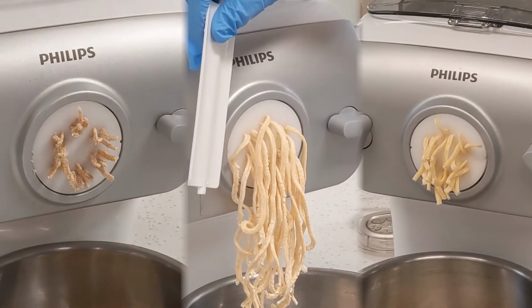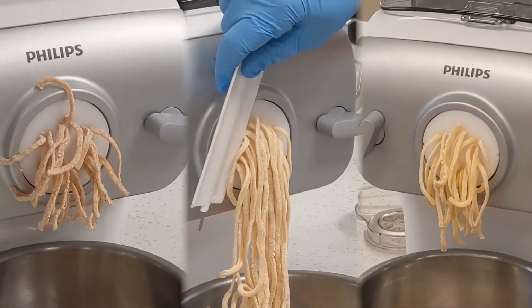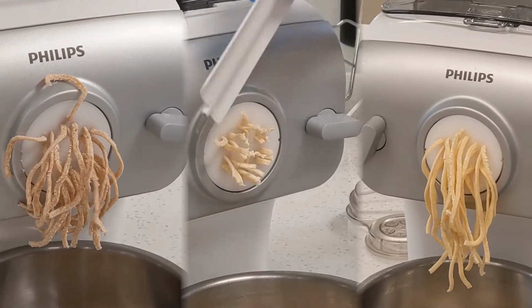So one example of looking at the different building blocks of foods is by making pasta. Students look at the different flours that are used in pasta manufacturing using an extruder and look at how the different flours affect the quality and the longevity and the tastiness of the pastas.